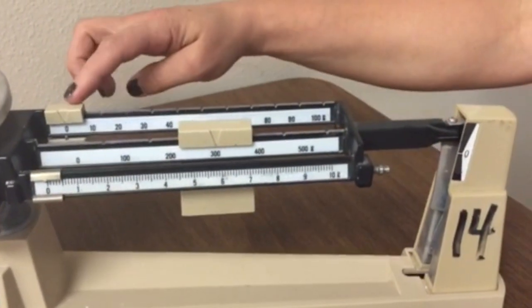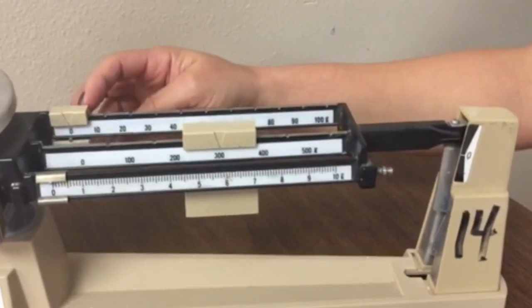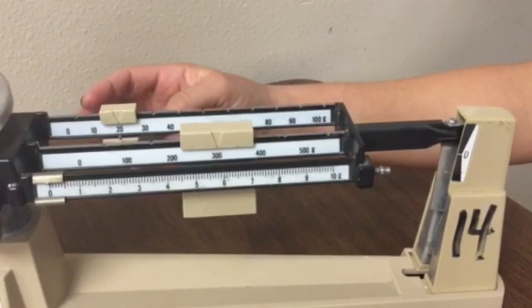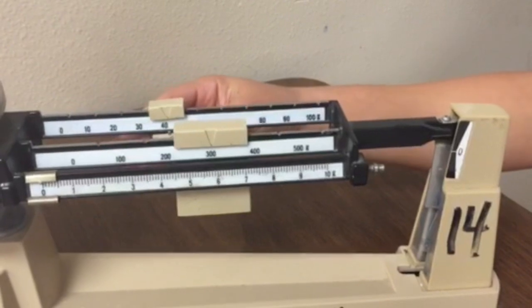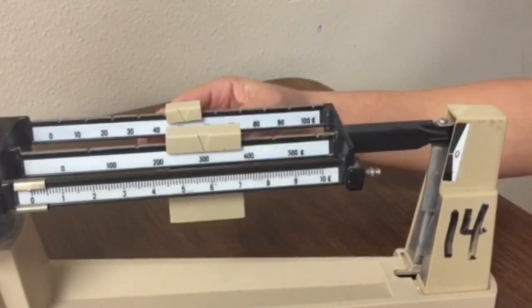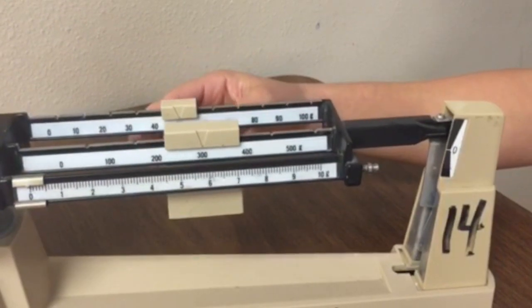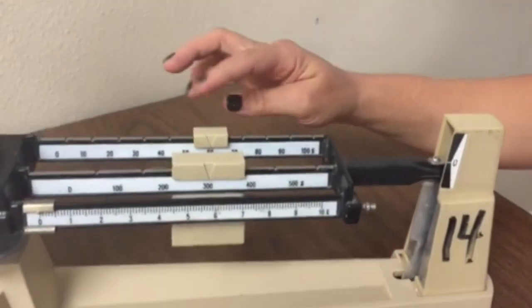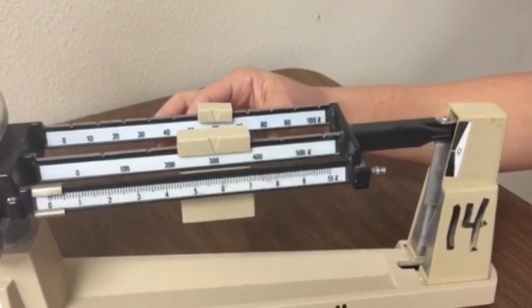Next I'm going to move my tens and I'm going to move that one to see how far that will go. Try it at 50. Okay, so 60 is too much, so I'm going to go back to 50.